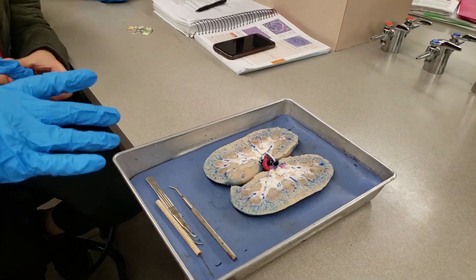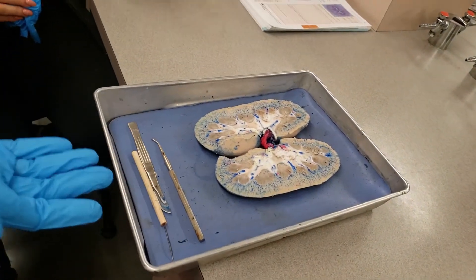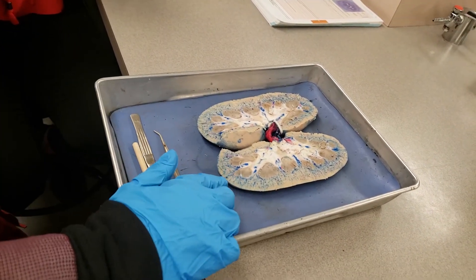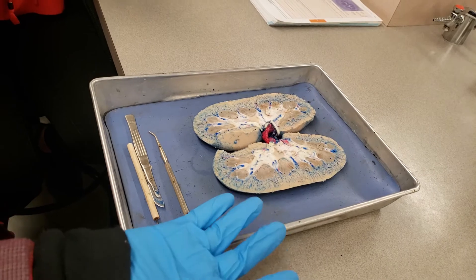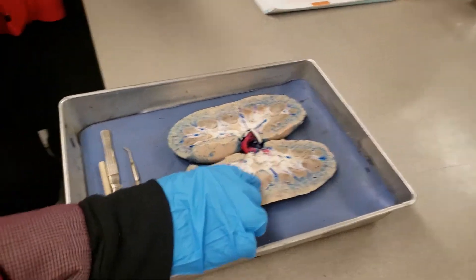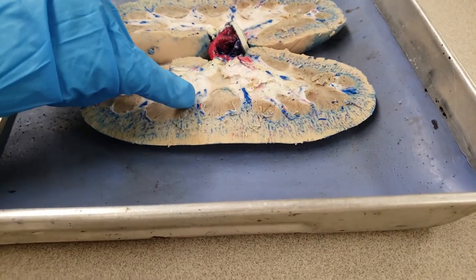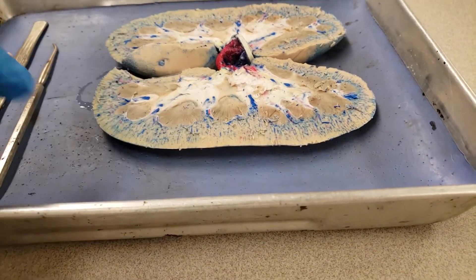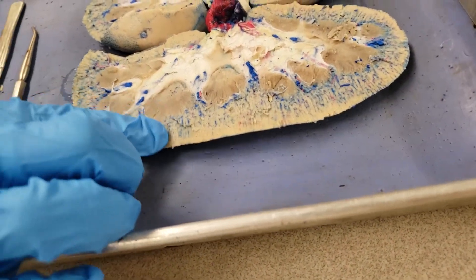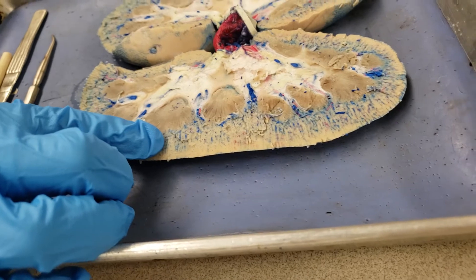We're going to go over the kidney — great job on this dissection. Between the lobes, that's called the interlobar artery and vein. And then if it's around the pyramid up at the top, those are called arcuate — beautiful.